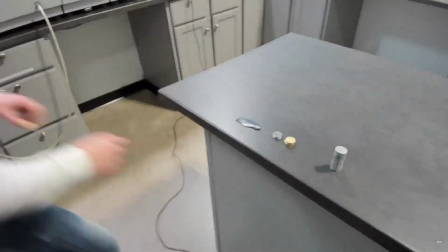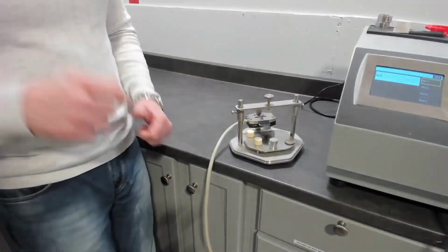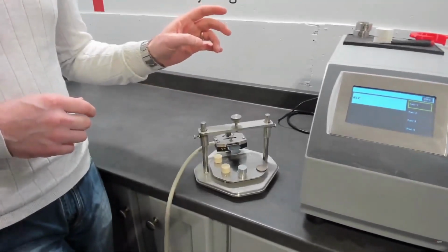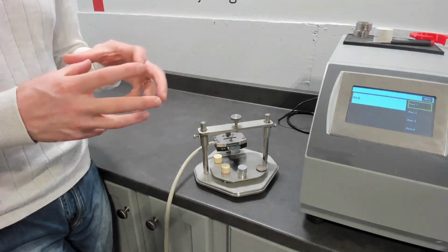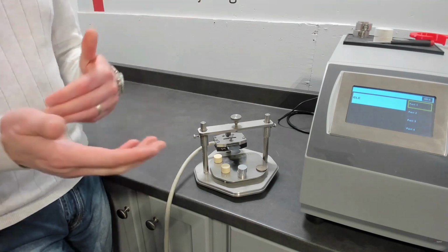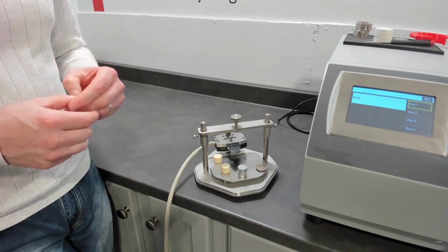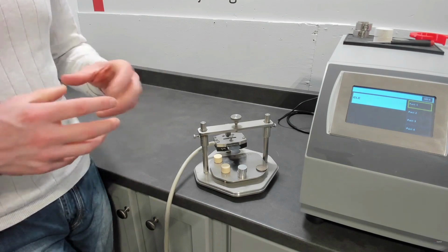I'm just grabbing the pieces here. We've got a specific set of sensors designed for use on 1D slab. If you acquire the one-dimensional module on the MP-1, you get the 1D slab as part of that same package. So you can run the sample according to ISO 22007-2, or you can run it with this new upgrade, which is 1D slab. You get both of them when you purchase the 1D module, because they're so closely related, with the advantages of both, I think it's important to keep them together.